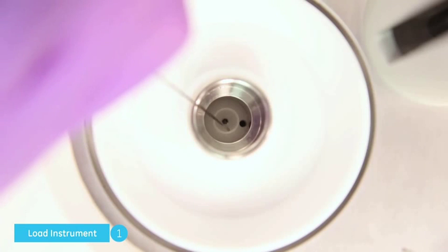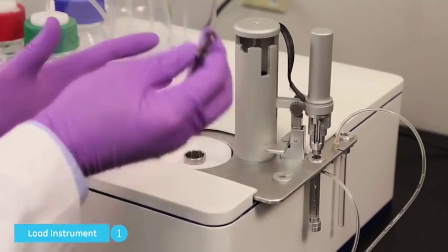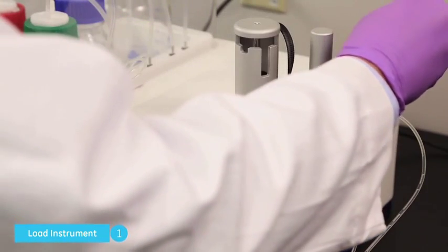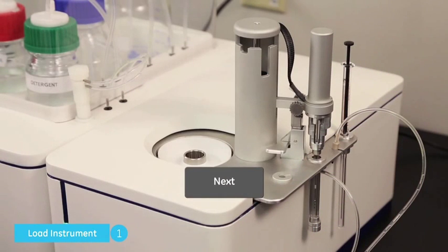Remove any excess sample in the cell port overflow cup using the loading syringe and return it to its storage location. Click Next.